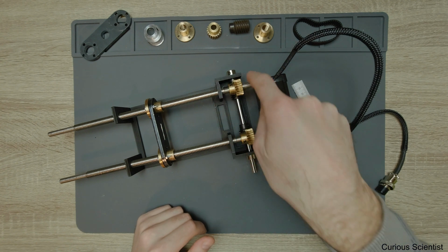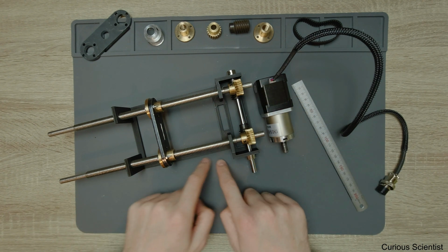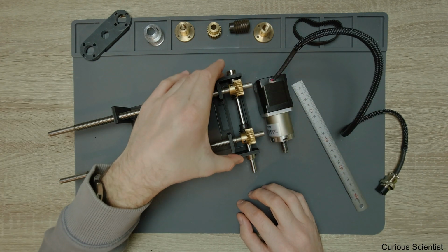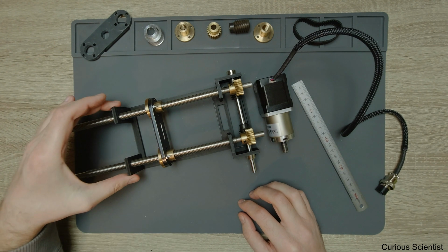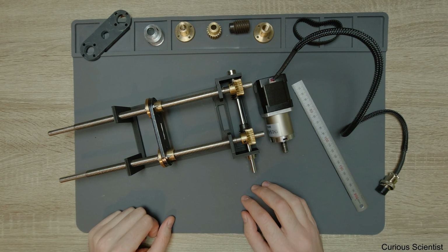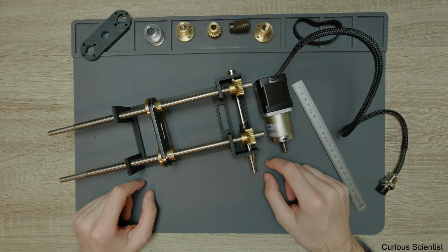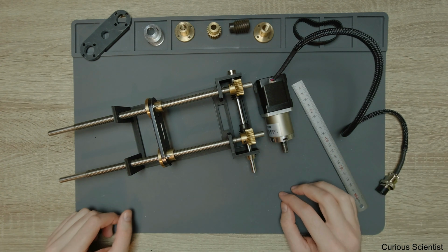And then once this metal part here is done, then I will assemble everything. I will also need a base plate to screw this metal part on it and screw the other side of this structure on it, but that's not a big problem. That will be made of some structural steel and will be cut by laser, and that's all. So that will be very, very simple.